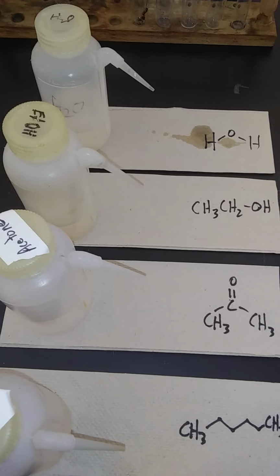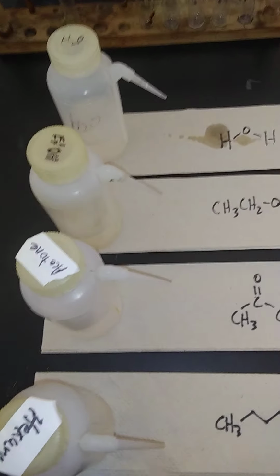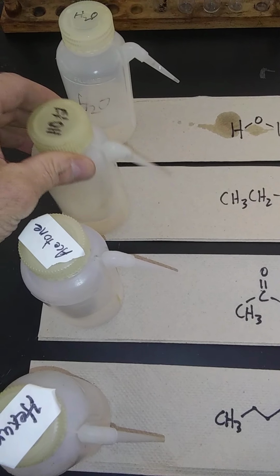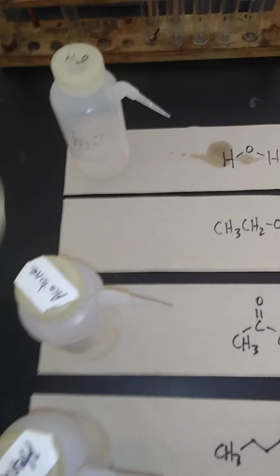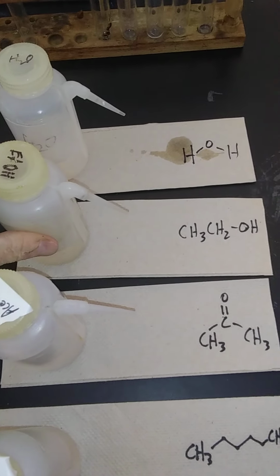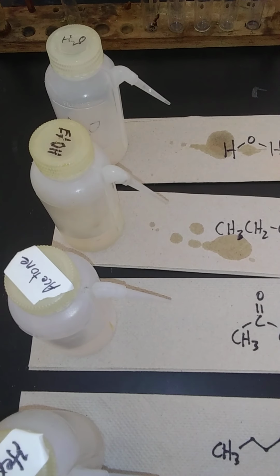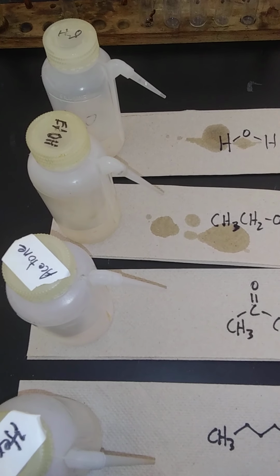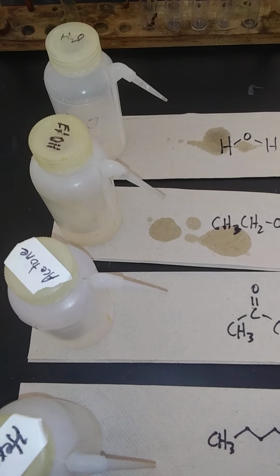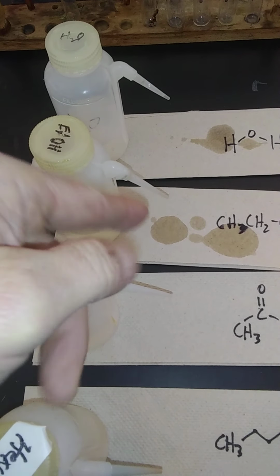I'll shake the bottles, squeeze bottles, and then I might just squeeze them a little bit just to get it started. I'll squeeze a little bit and see what happens as far as the solution. Does it stop? Does it continue to drip? Like we're seeing ethanol pushed out a little bit more ethanol. It is a little bit more than what we had with water.